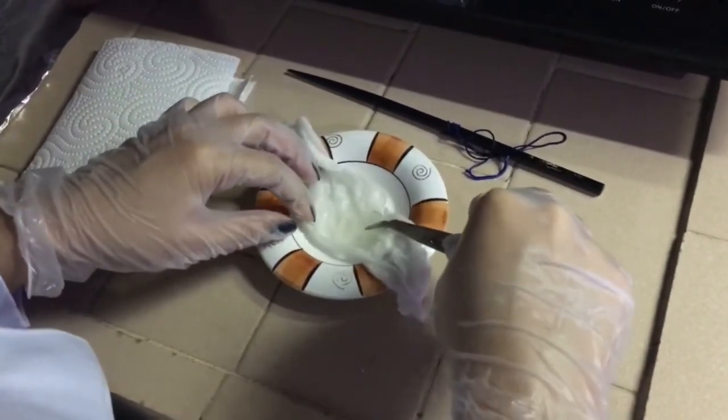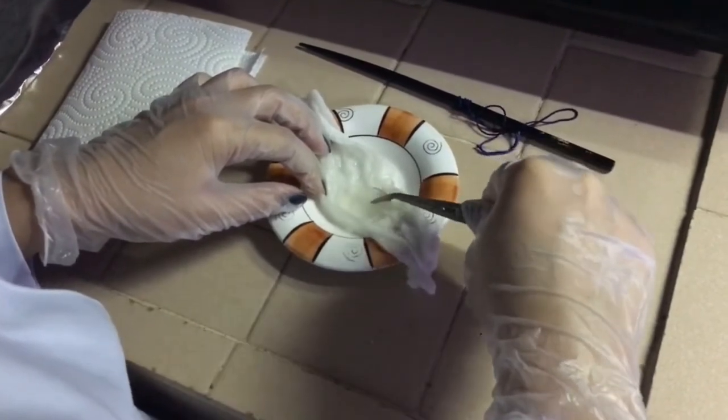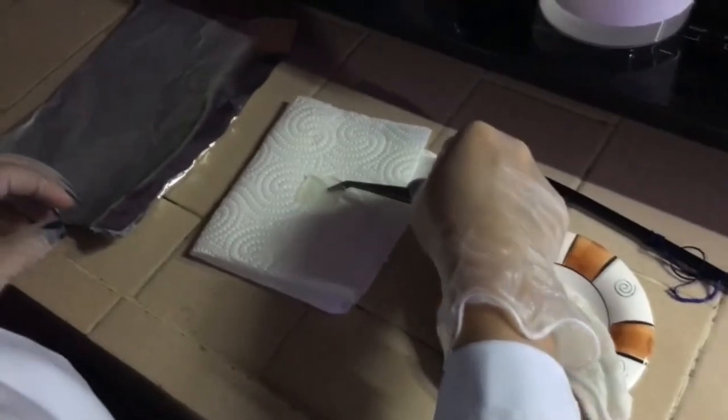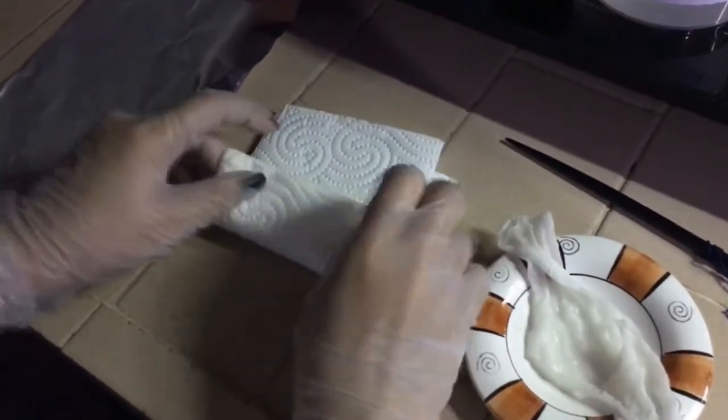As you can see, the tissue specimen has successfully completed the clearing process, and at this point we will be taking it out and placing it onto a tissue paper to drain or dry it from any excess reagent that is sitting on the surface of the tissue.